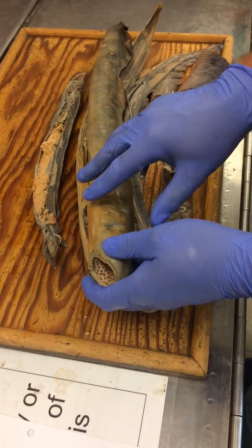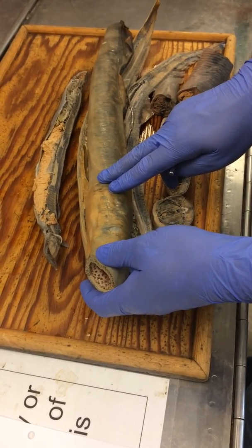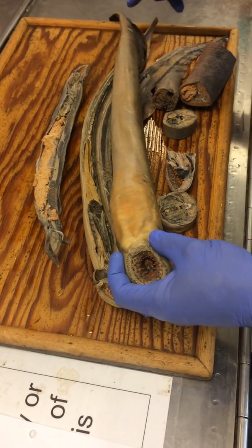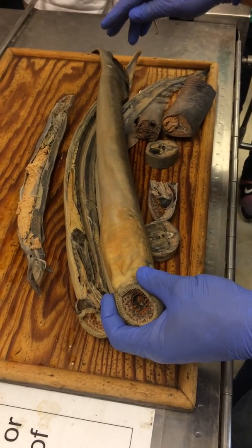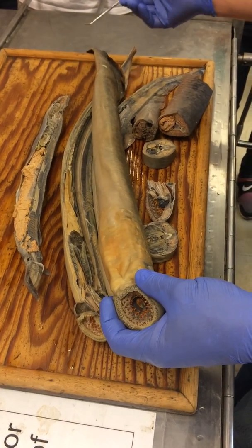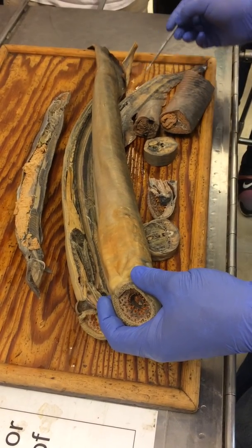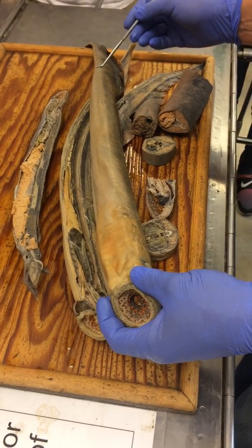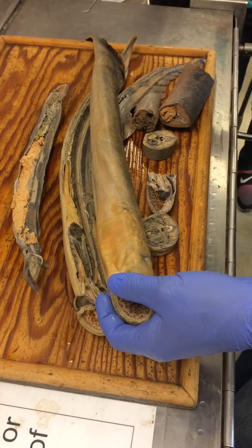Head region, including the gill slits — just so you know, that is part of the head — then trunk. Where does the tail start? How do you decide where the tail starts? After the cloaca — basically everything behind the cloaca by definition. And one thing to think about is that that's also where the body cavity ends. There's body cavity in the trunk region, but not in the tail.